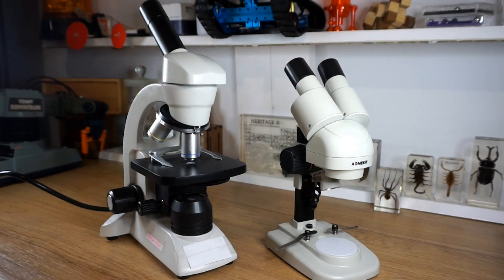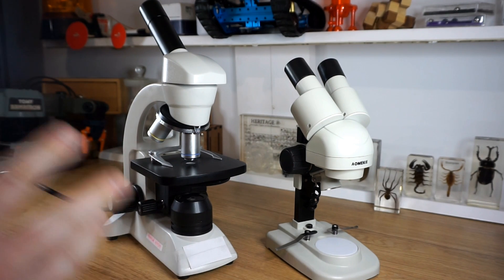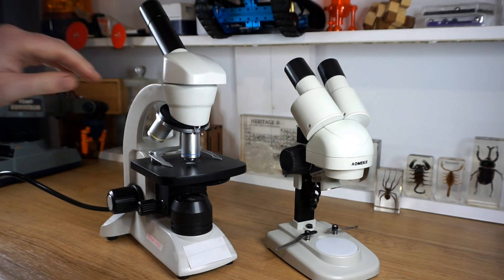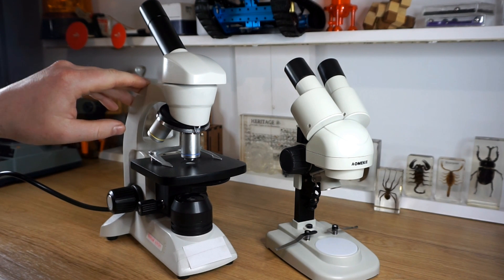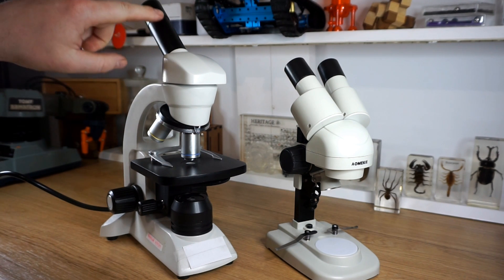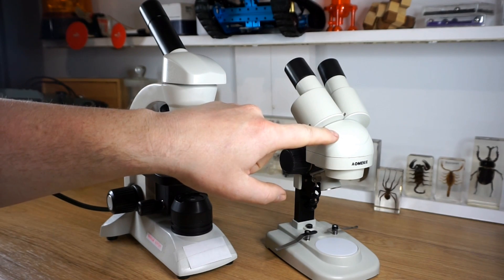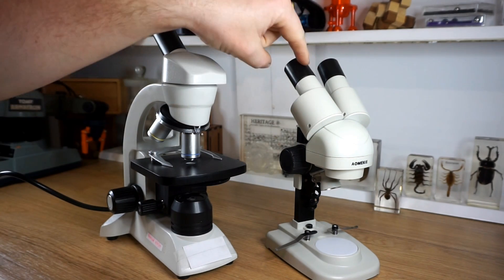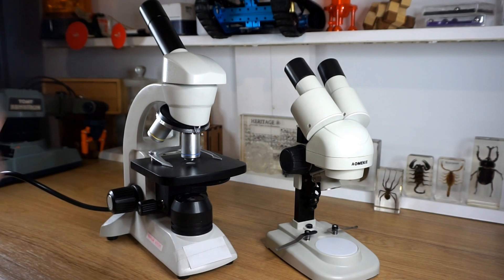So these are the two main microscopes that your school lab will often have. We've got a compound microscope, also called a monocular microscope because it has one eyepiece. And then we have a stereomicroscope, also called a binocular microscope because it has two eyepieces.